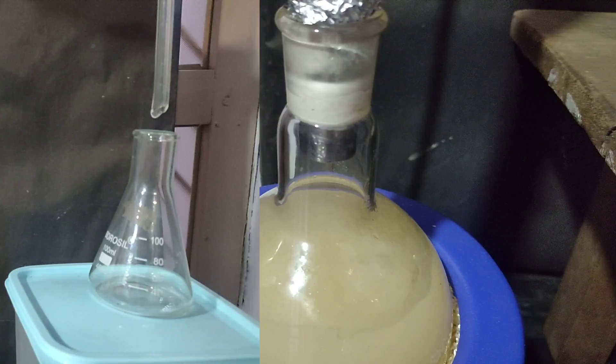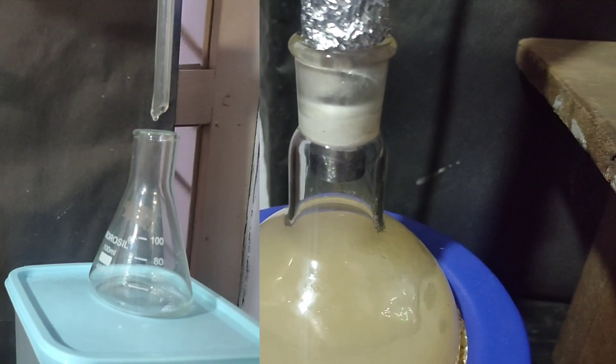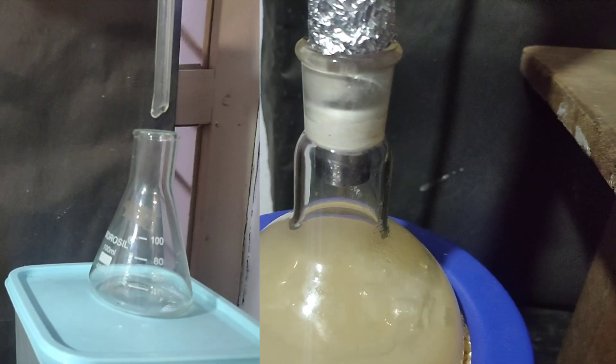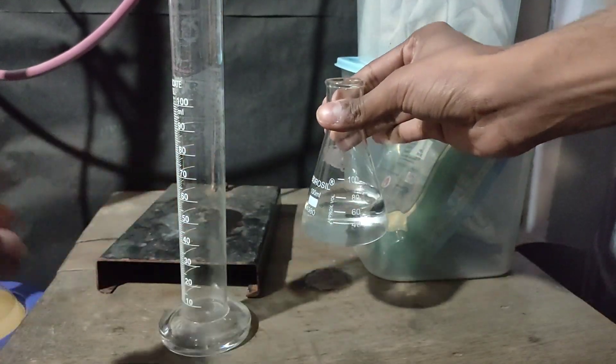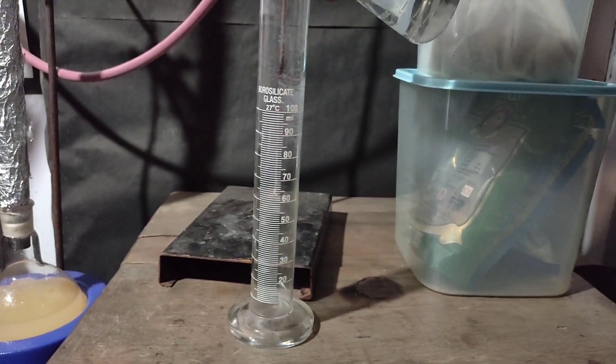Which is the boiling point of 95.6% ethanol-water azeotrope. The reflux is also happening very well. In the end, when no more distillate came over at 78 degrees Celsius, I stopped the distillation.